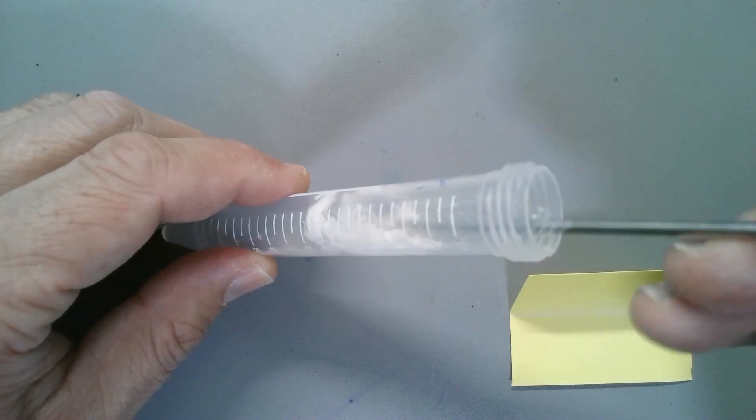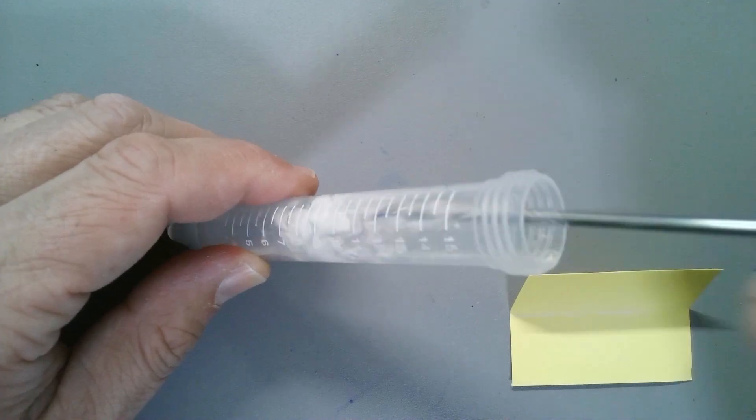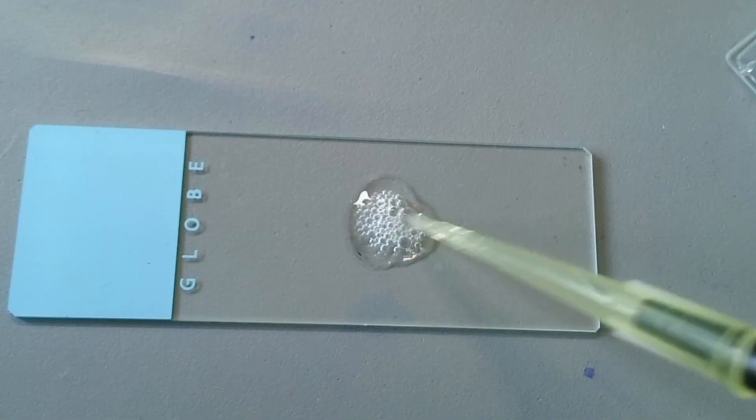And this is basically what you add. And I usually add approximately the same amount of methyl cellulose. And you can adjust a little bit the amount of methyl cellulose that you add to the drop of water. The more that you add, the slower the microorganism is able to move.